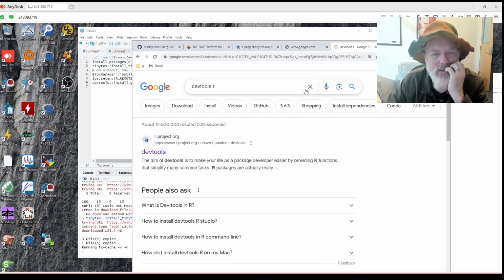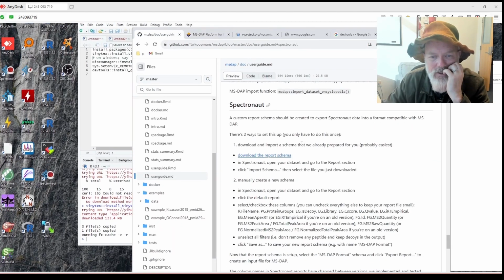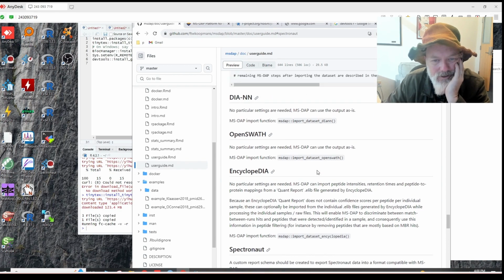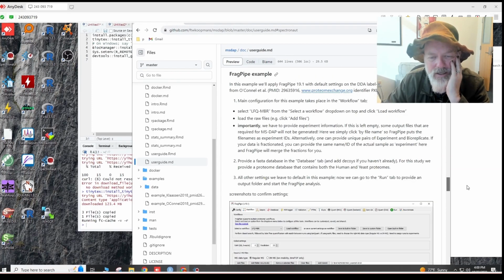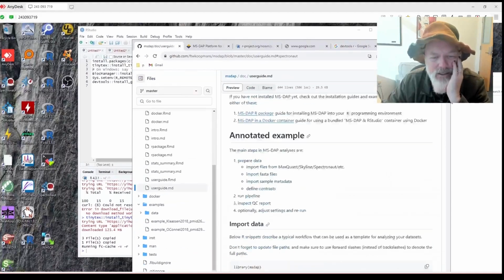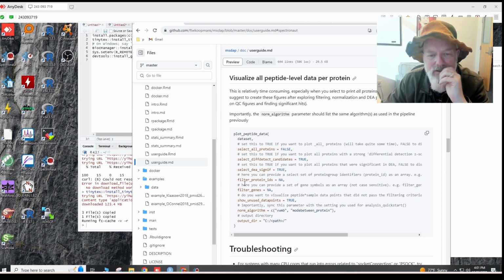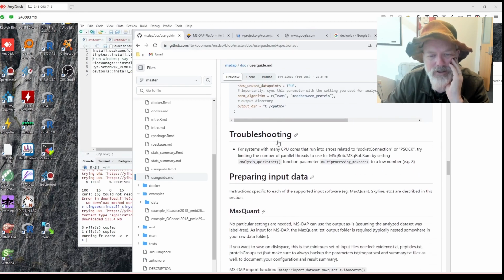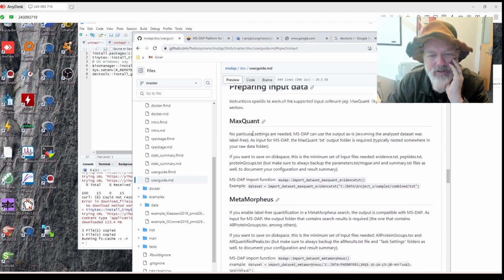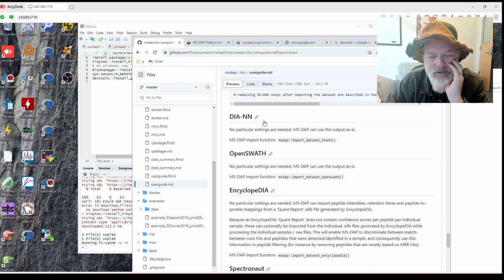Okay. All right, so let's see what else MS DAP does while we wait. So here's the publication. It looks super cool. We have the Spectronaut format. It gives you instructions for DIA-NN, OpenSwath, really nice ones for FragPipe for doing LFQ MBR, label-free quantitation. Let's see. So this should really test it because we have about 117 timsTOF HT files we've sent through Spectronaut. And the report is 4 gigabytes, so that's pretty big. Let's see. I wouldn't recommend MaxQuant. Oh, it even works for Skyline. That's super cool.